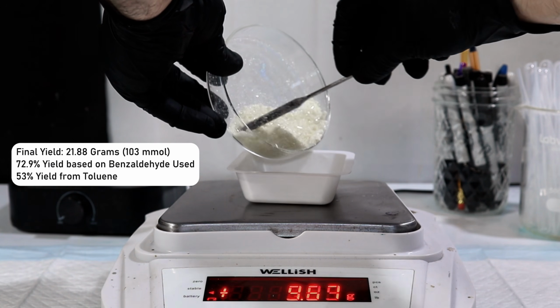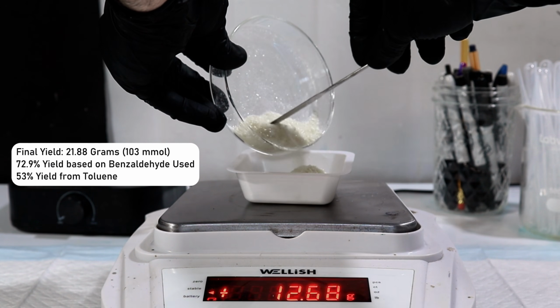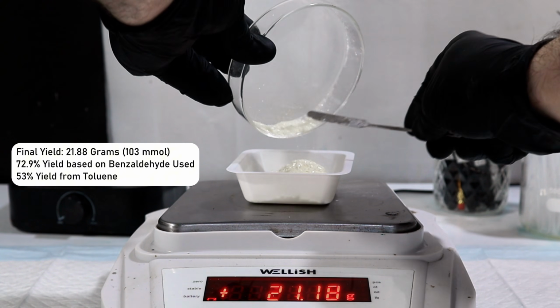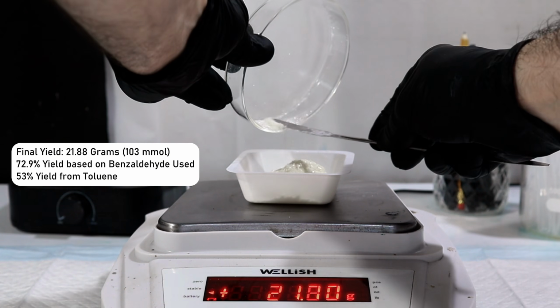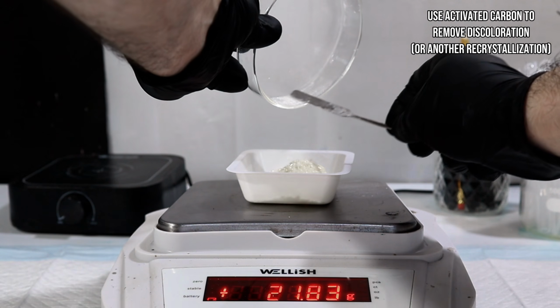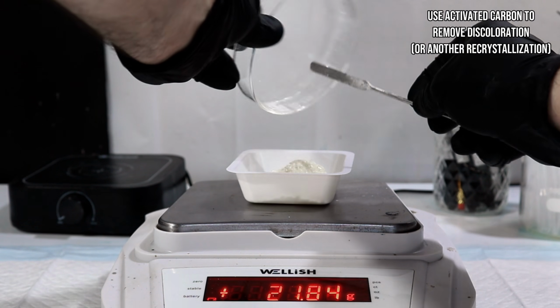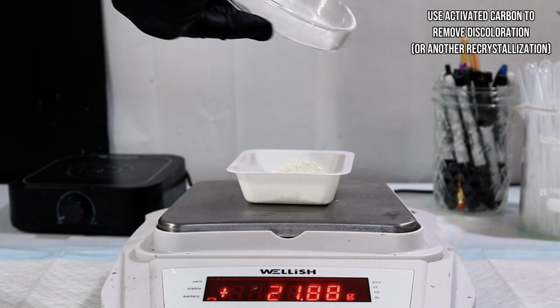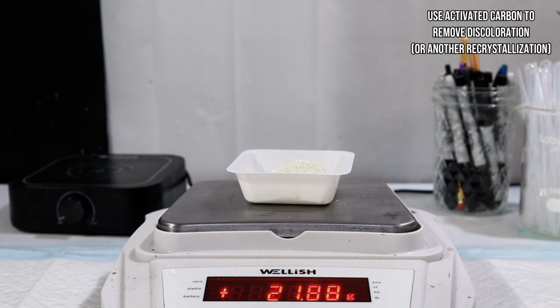Now, you'll notice that the crystals are ever so slightly yellowed, and I'm not really positive whether this discoloration is due to using homemade benzaldehyde or if this is something from the activated thiamine. Regardless, it can probably be very easily removed by simply boiling the recrystallization mixture with activated carbon and then filtering it off before allowing the crystals to form.